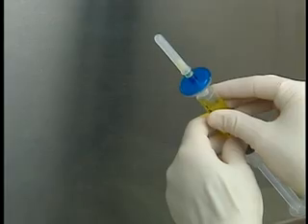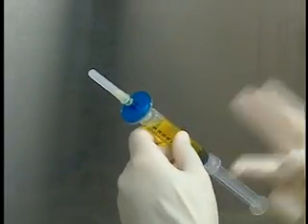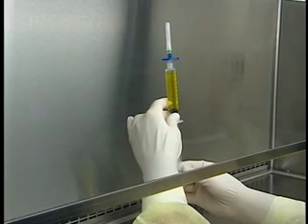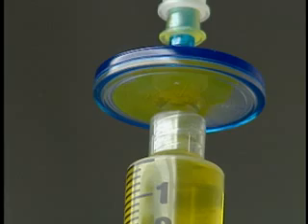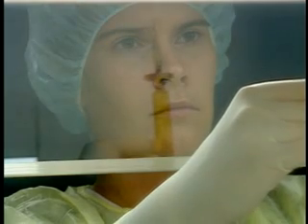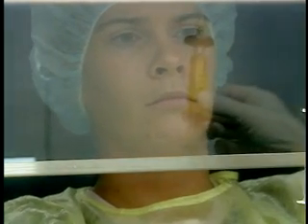With the syringe in a vertical position, pull first on the plunger and then expel the air from the syringe. Wet the filter with the solution. Check the volume and have the product checked according to facility protocol before filtering.